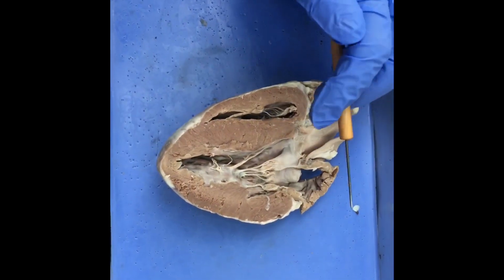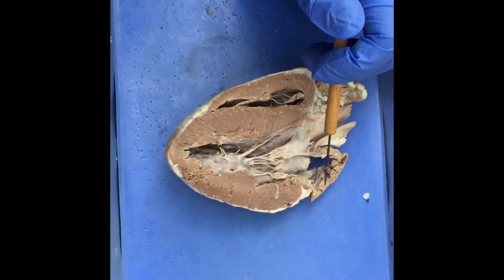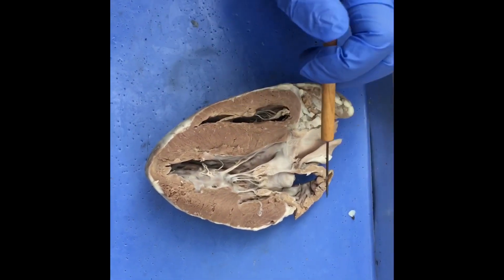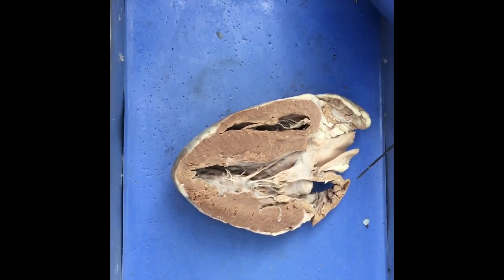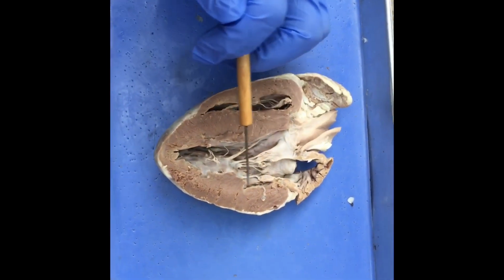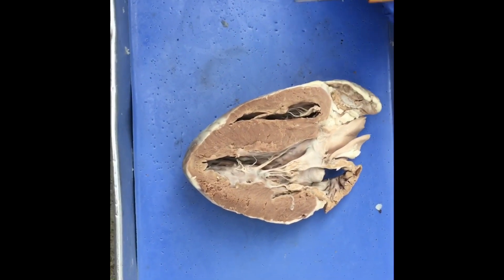Oh, by the way, I should probably mention that when the deoxygenated blood was being carried from the right atrium to the right ventricle and then to the lungs, that's called pulmonary circulation. And when it was oxygenated blood transported through the left atrium, through the left ventricle, and to the rest of the body, that's called systemic circulation.